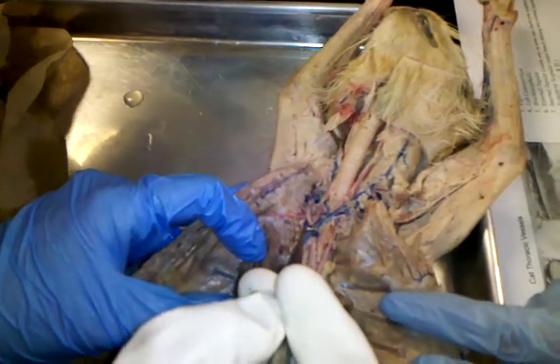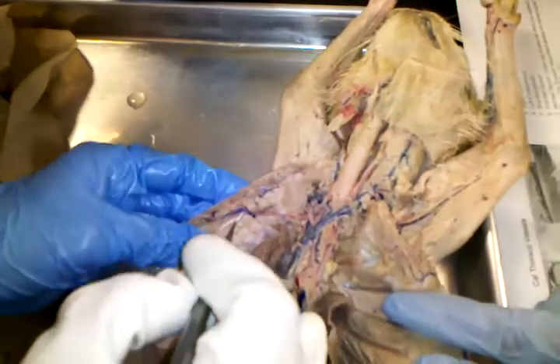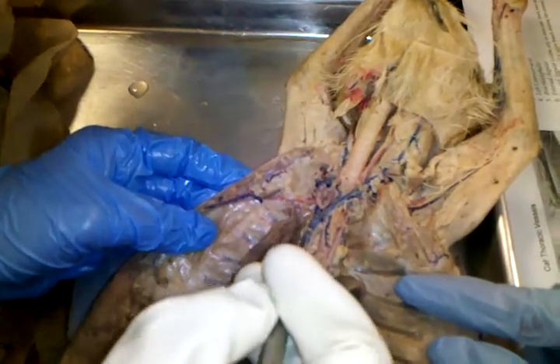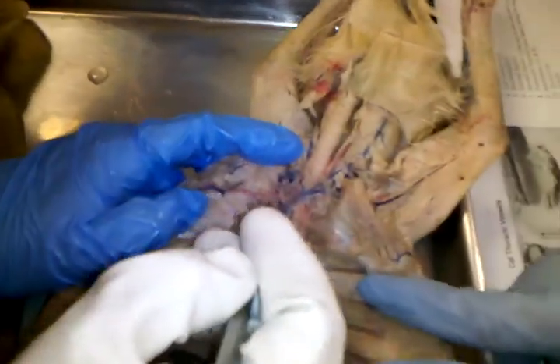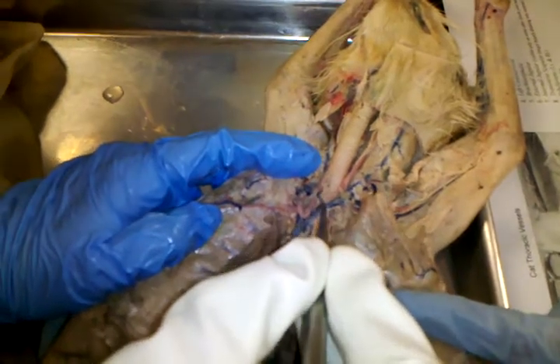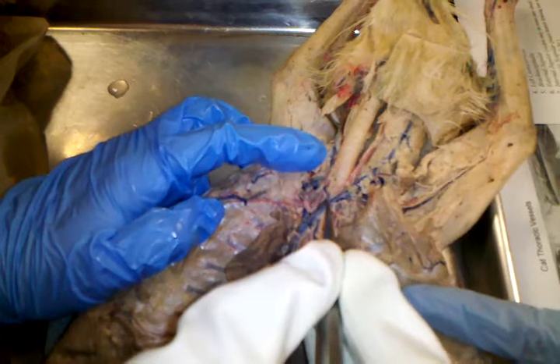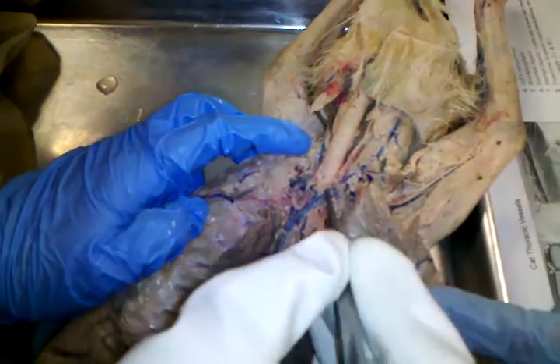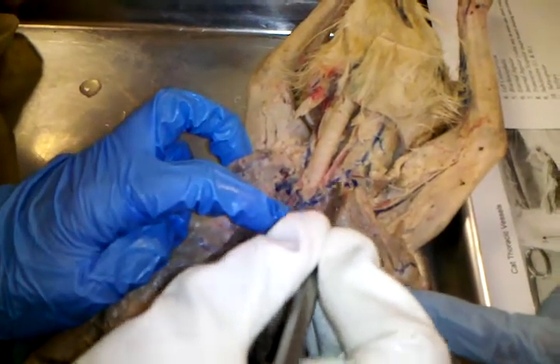By the way, you can see where the internal mammary was coming off vein to drain the chest. See where it got broken right there? You often have to pull this out of the way, and so sure enough, it was pulled out of the way. Okay, so it's called brachiocephalic just very briefly until anything else comes off, and then it changes names to subclavian. Okay, and so right here it changes to subclavian.